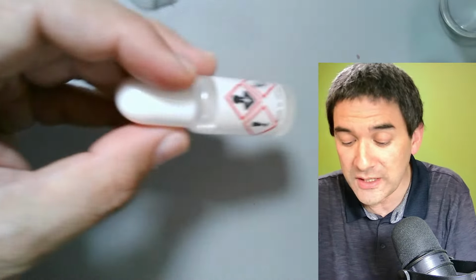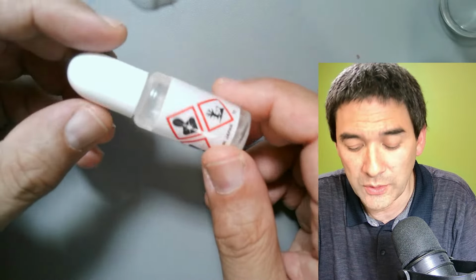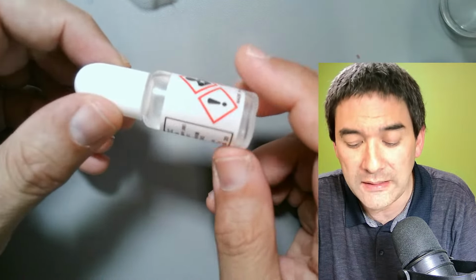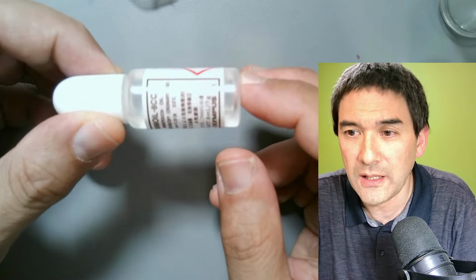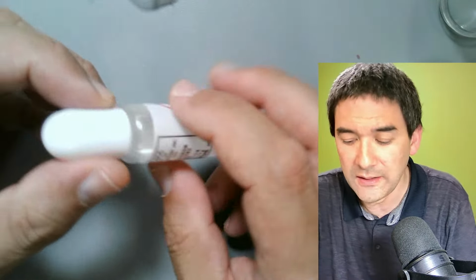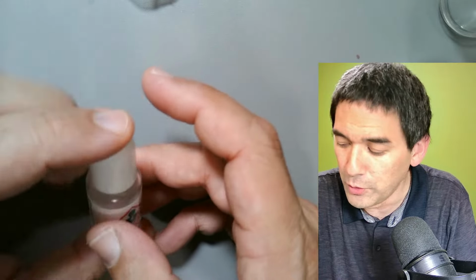The situation is a little bit different if you use synthetic immersion oils, like the one that I have over here, because they remain liquid. Okay, so there is a difference. This is basically something that I just want to inform you about.